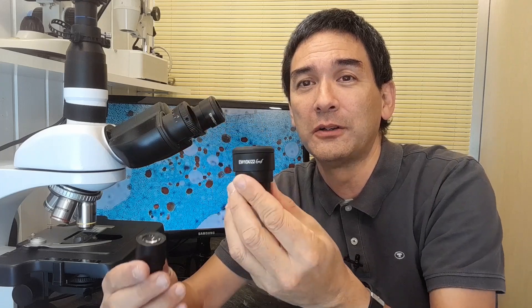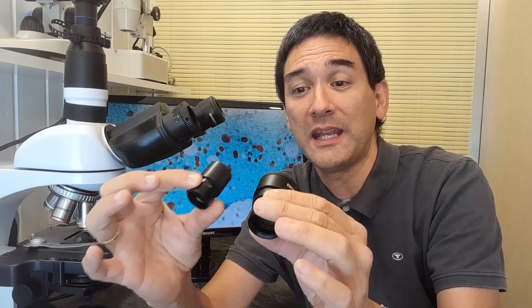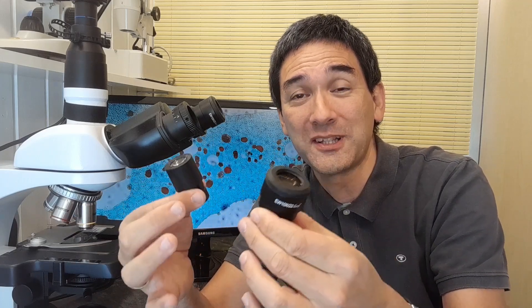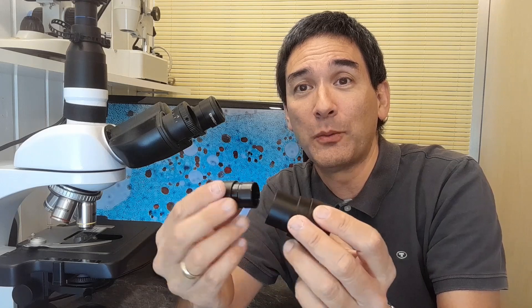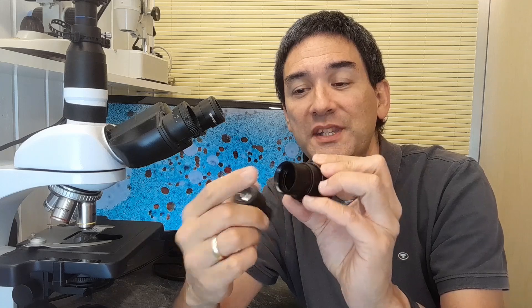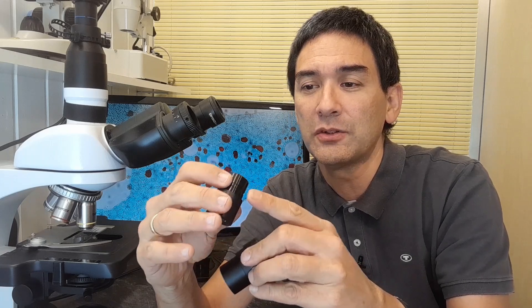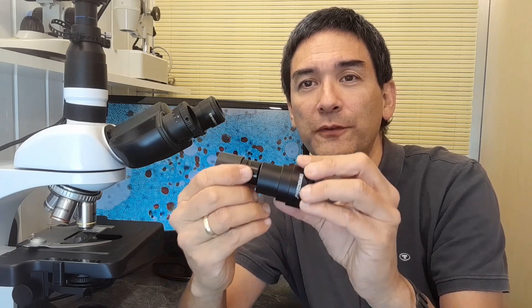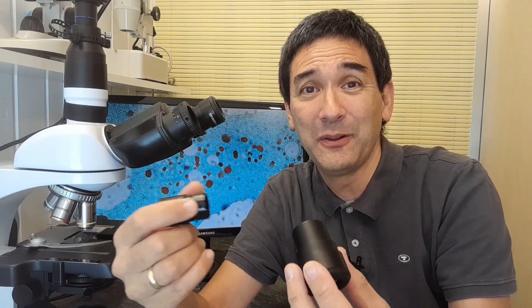I've got a big one over here and a small one over here. Both of them magnify the same amount — 10 times. But what's the difference? Obviously the size is quite different, but how does this impact the image that we see? Just compare the diameter: this one is about 30 millimeters across — three centimeters. This one over here is about 23 and a half millimeters across. So it's approximately seven millimeters difference, and this actually has quite a significant impact on the image that you see.